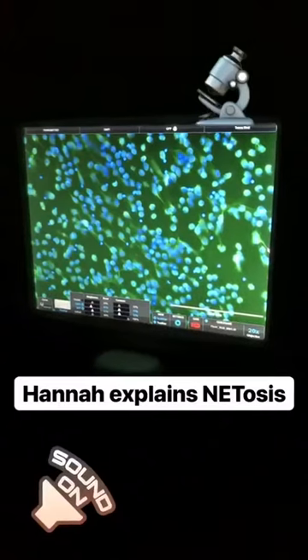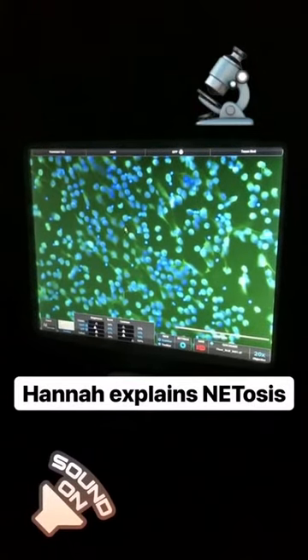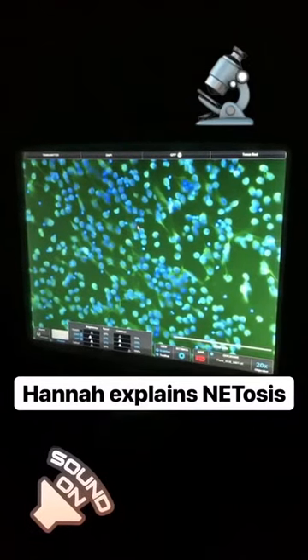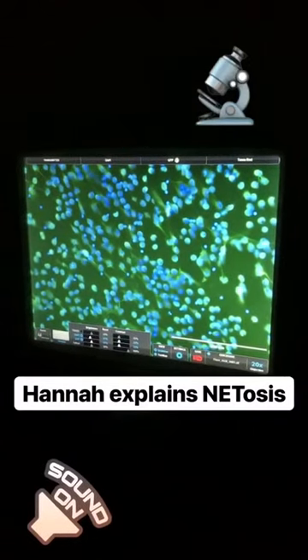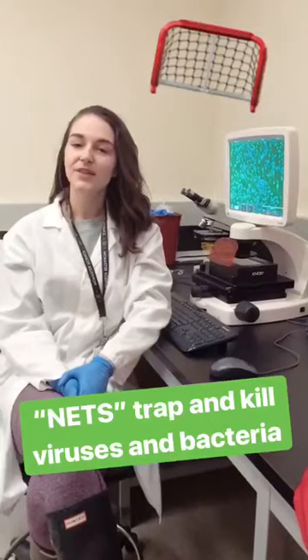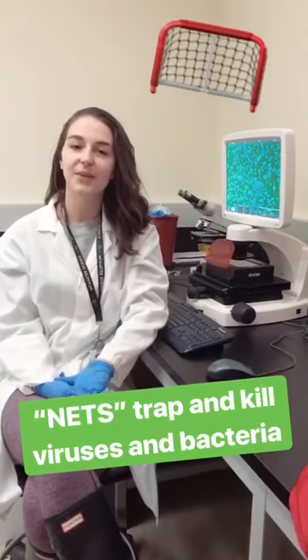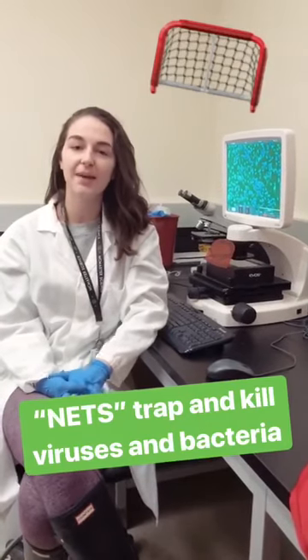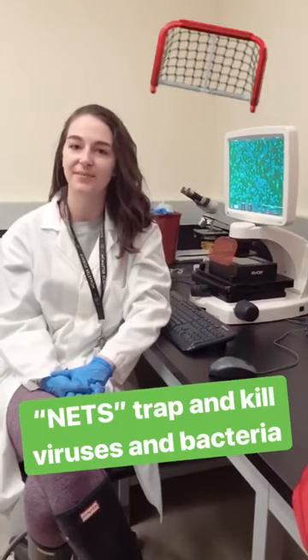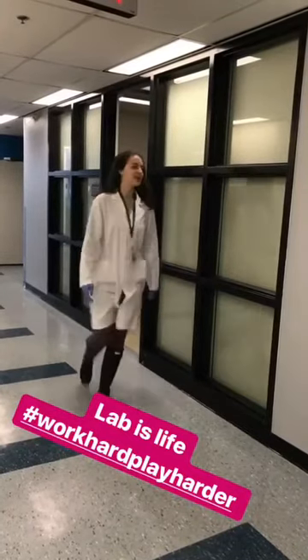Here you can see white blood cells — the blue is staining for DNA. When you see the blue and the green stains mix, that means the DNA has been released outside of the cell and the cells have undergone a process called NETosis. Neutrophils release neutrophil extracellular traps, which is DNA coated with enzymes, and it helps your body trap and kill a various number of pathogens such as bacteria, viruses, and fungi. I live in this microscope room.